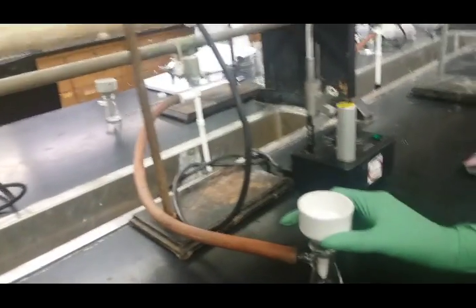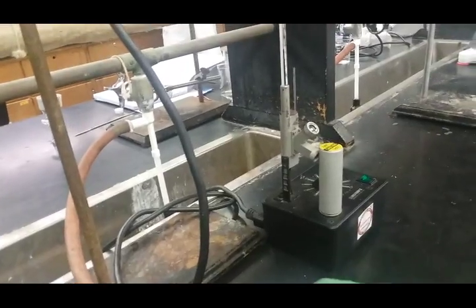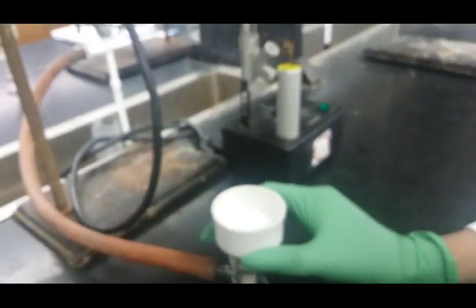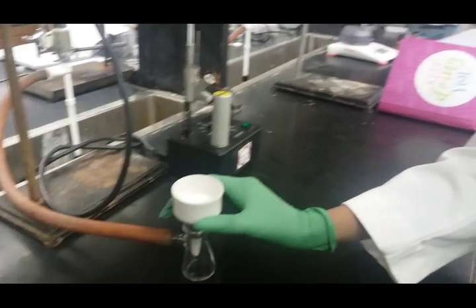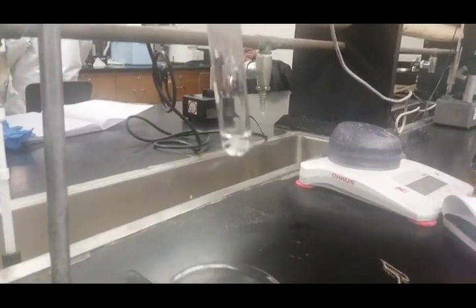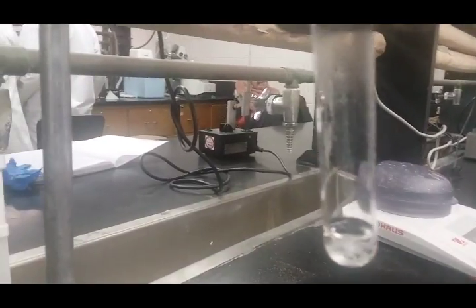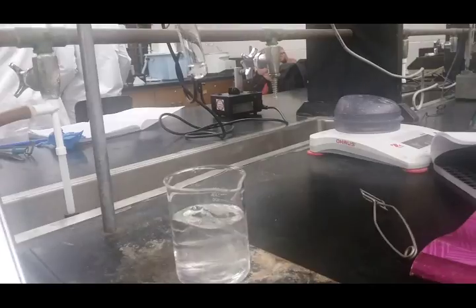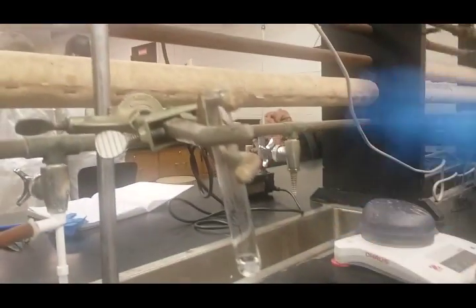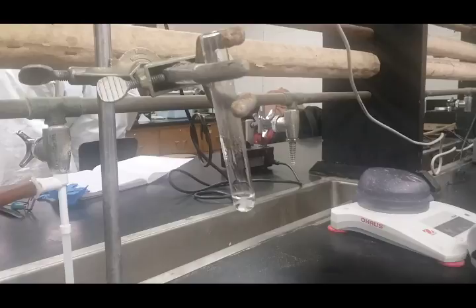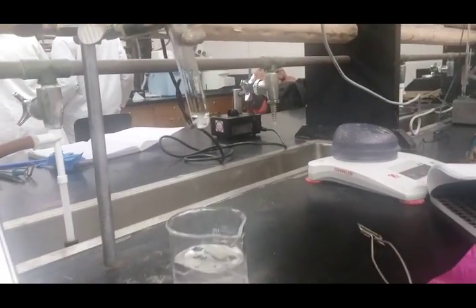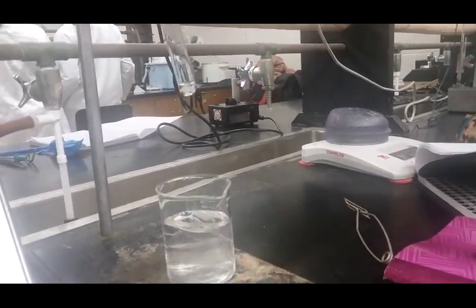So this is group one, they did awesome work today. They're all done and they wait for it to dry to take the percent yield. What did you do to get the crystal? So we just took it from the sand bath and then we just let it cool, clamp it in here and let it return to room temperature and cool. In here is the phthalic acid and water.